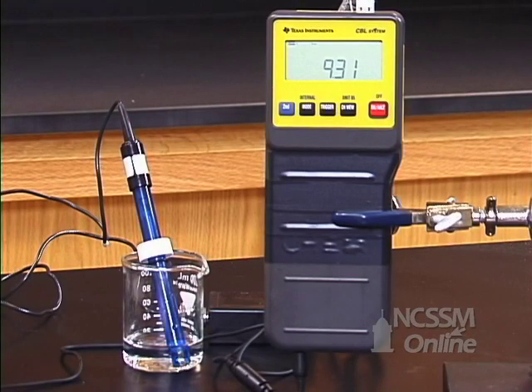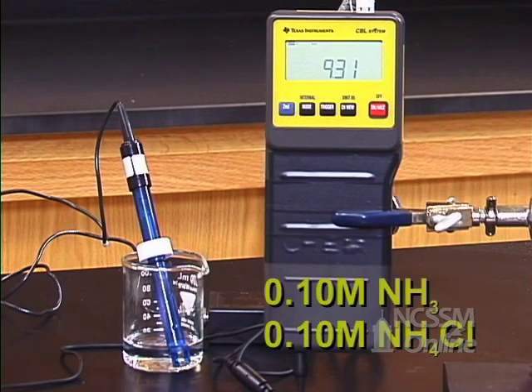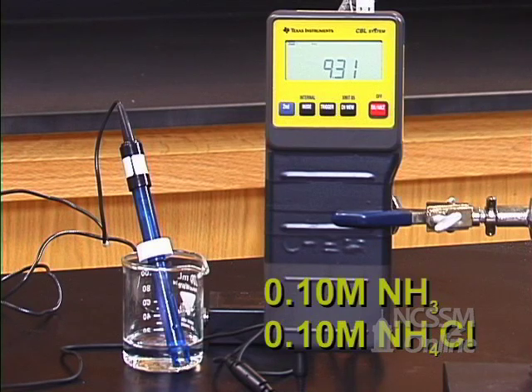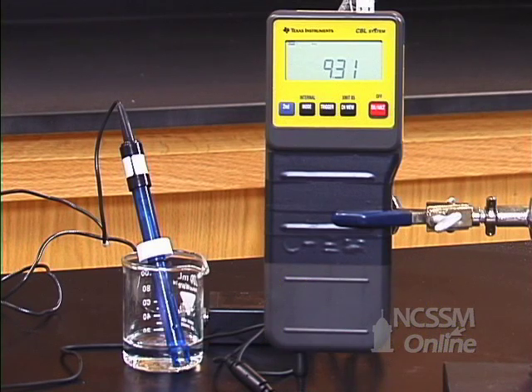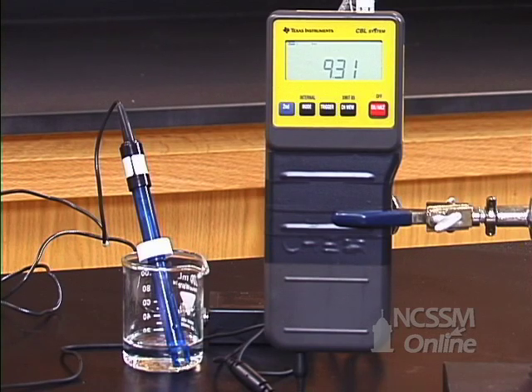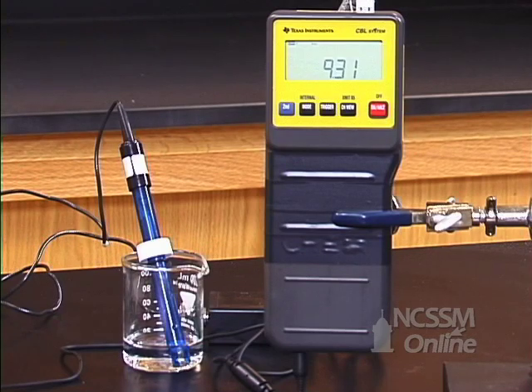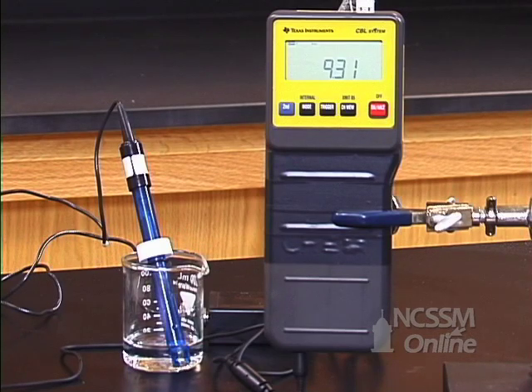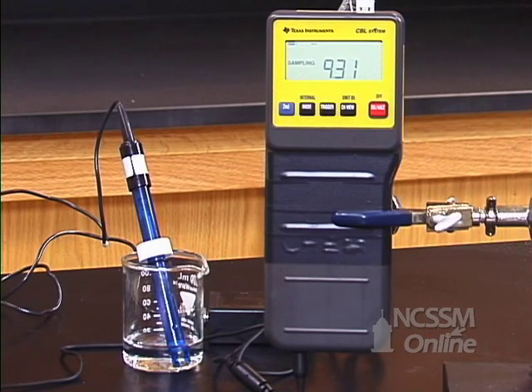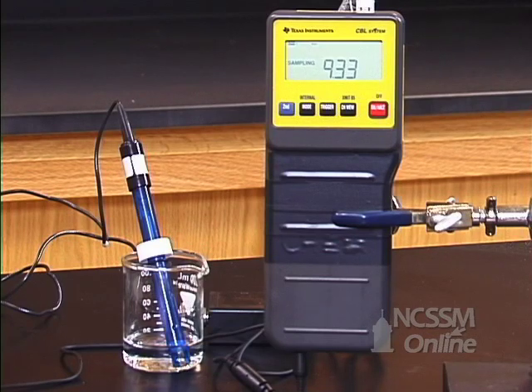I have a buffer solution that has 0.1 molar in ammonia and 0.1 molar in ammonium chloride. Notice that the starting pH is lower than the pH of just the 0.1 molar ammonia — we've added some of the conjugate acid, so the pH is lower. A solution of a weak base and a conjugate acid also acts as a buffer.